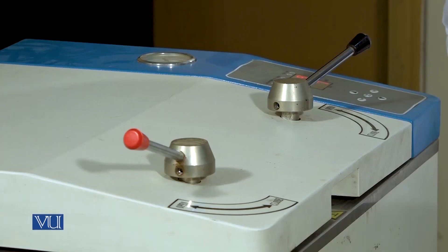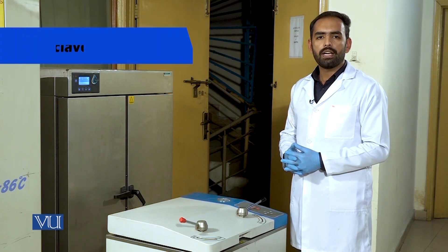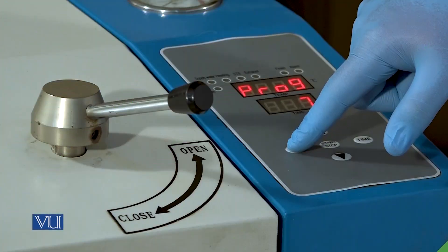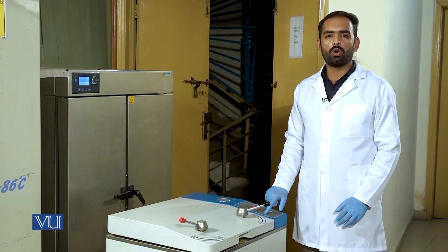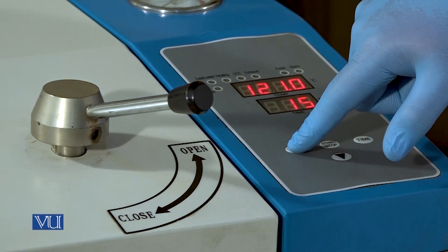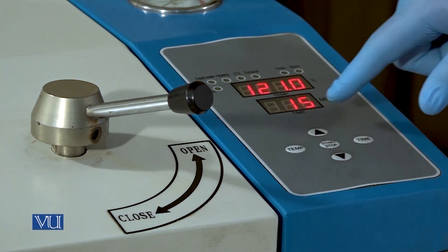Next, the physical method of sterilization is done by using moist heat. The laboratory apparatus designed for sterilization using moist heat is the autoclave. The basic principle of autoclave is to expose each and every article at 121 degrees Celsius at 15 psi for 15 minutes.